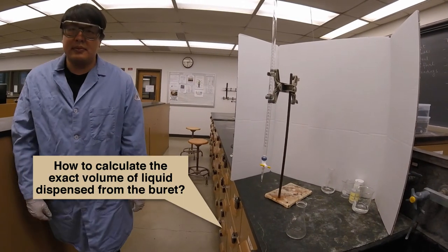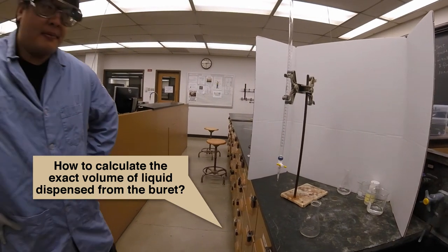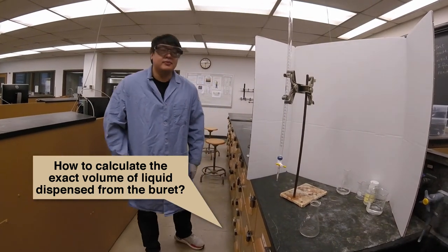So Matt, how to calculate the exact volume of the liquid that is dispensed from the buret?